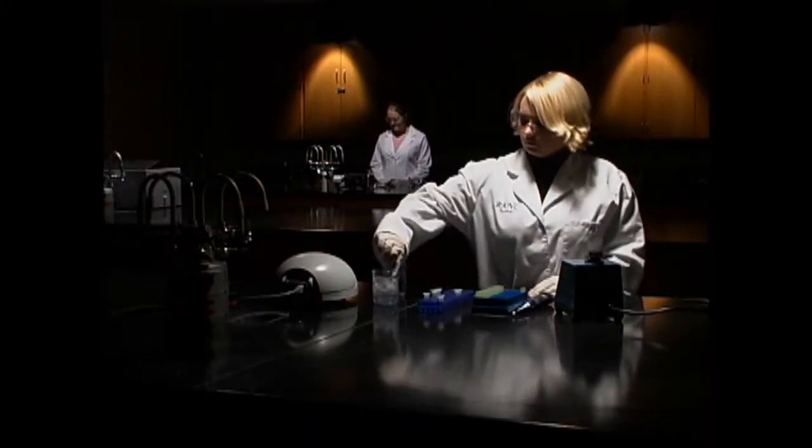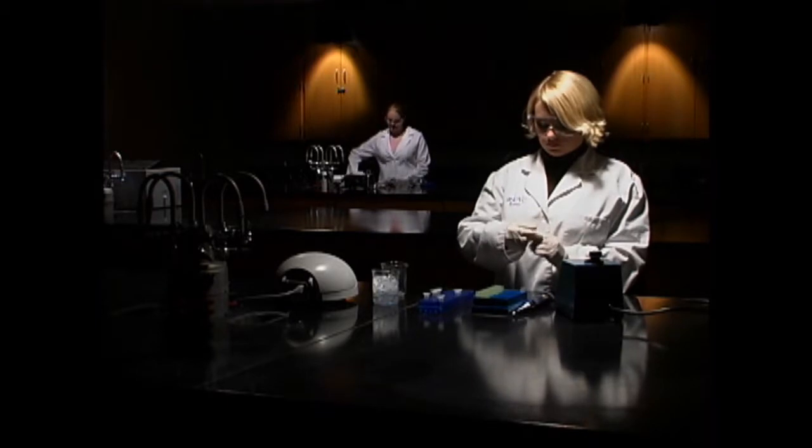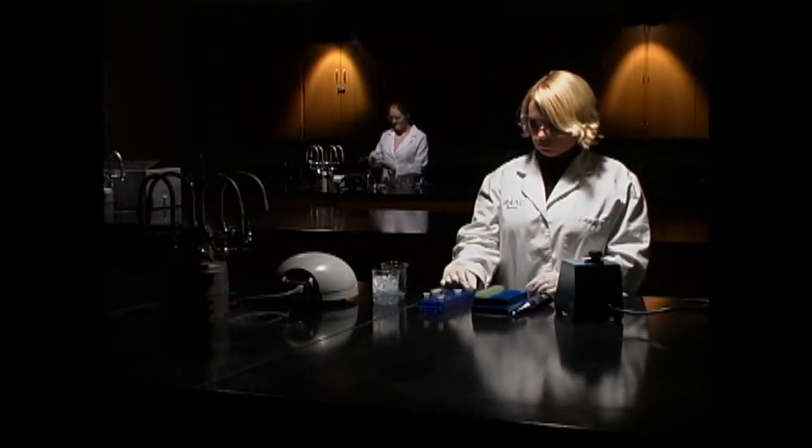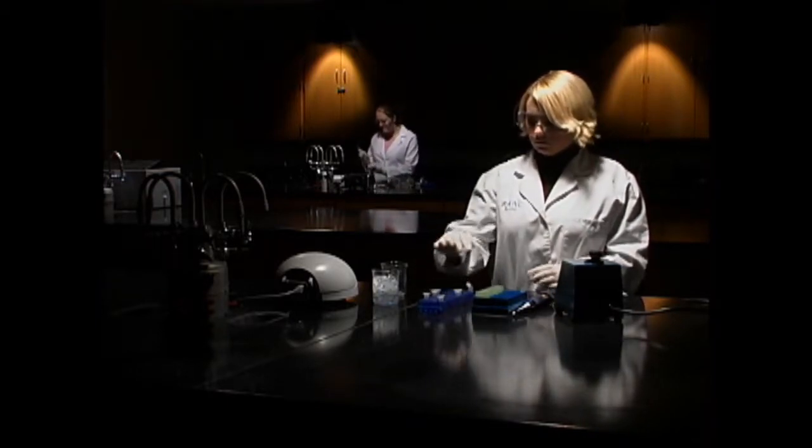This experiment will demonstrate the existence of plasmid DNA in E. coli cells. To isolate the plasmids, the other parts of the cell must first be broken down.